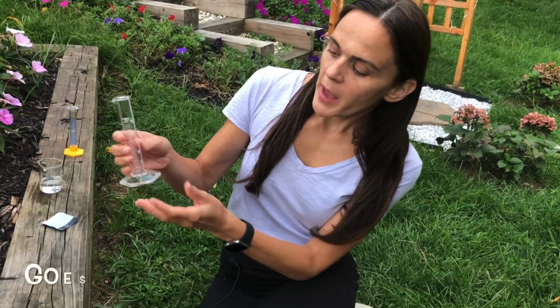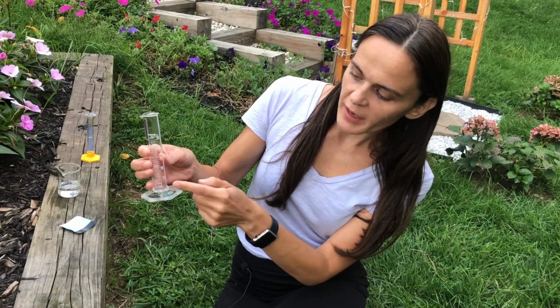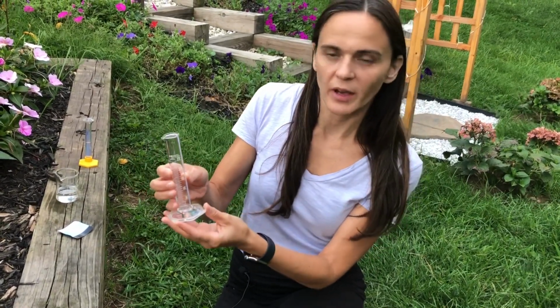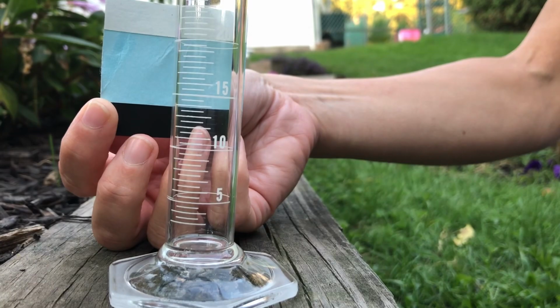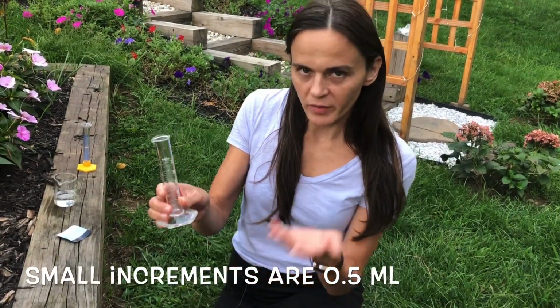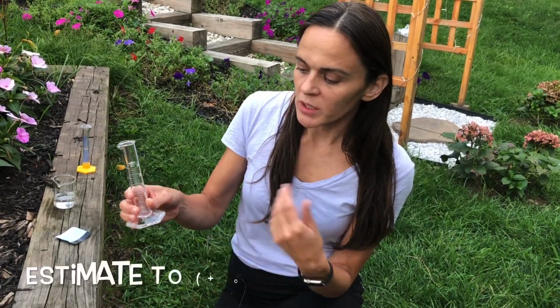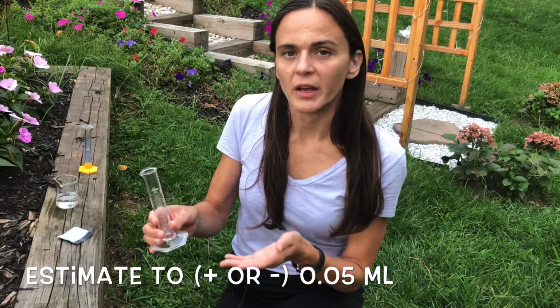Here we have a 25 milliliter graduated cylinder, and a 25 mL cylinder goes up by increments of 5. So we have 5, 10, all the way to 25 milliliters. The smaller increments in between are only 0.5 of a milliliter, and again, with a 25 mL graduated cylinder, you can estimate to plus or minus 0.05 milliliters, so that gives you 2 decimal places again.